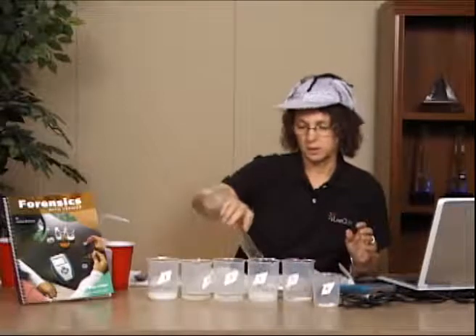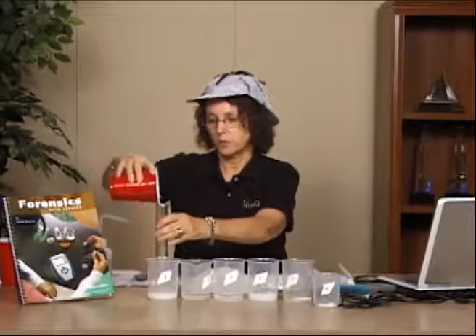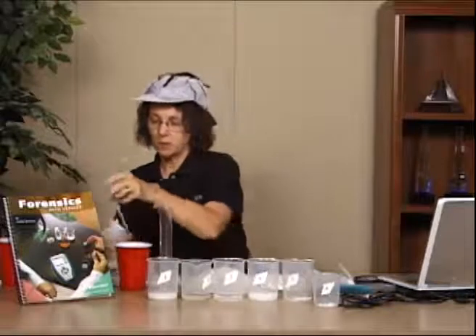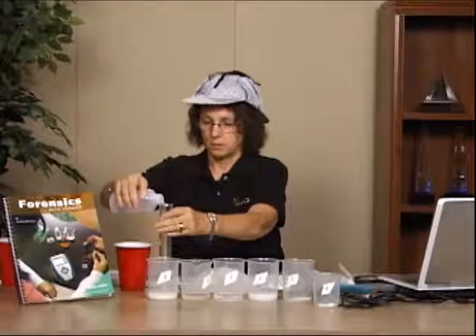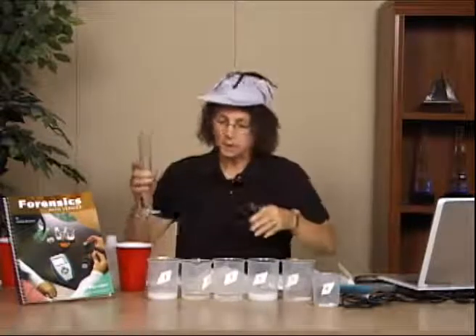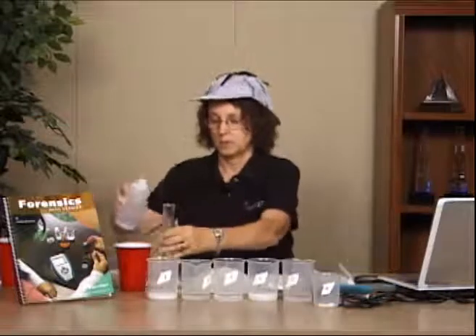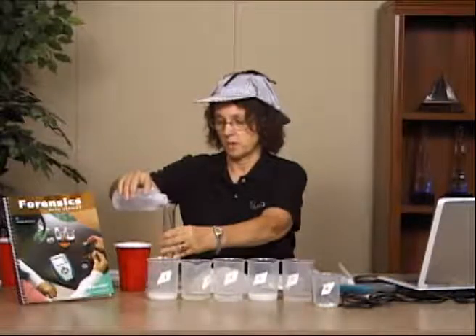So I'm just going to continue pouring my water into those beakers, and then I'm also obviously going to pour the water into my unknown. We're using distilled water. I've done this lab without distilled water. It depends upon how much distilled water you have, and if you're in a high school, you oftentimes have access to a lot of distilled water. If I'm doing this in a middle school, distilled water could be a little bit of a problem, and it works just fine with tap water as well.